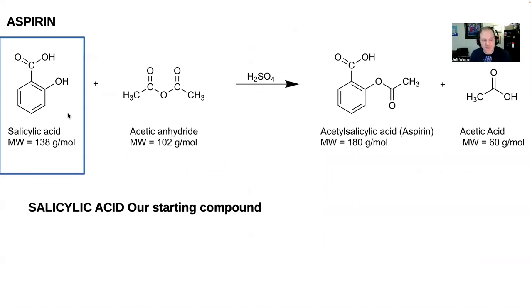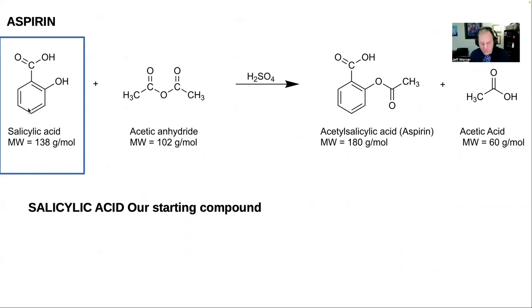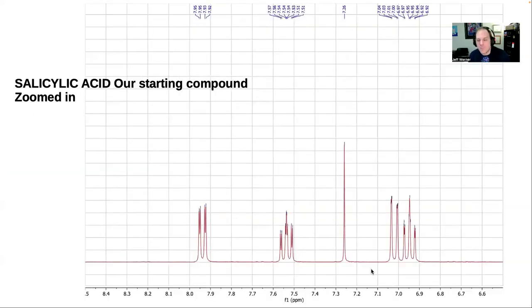So what does salicylic acid look like? If I take some salicylic acid straight out of the bottle, it looks like this. It looks different, right? There's something different going on here. Specifically, let's look at this pattern here. This is the downfield area associated with this aromatic ring, which is what's going to give us the most information to tell these apart. You can see that this pattern is different. This peak here is actually the same. Look at that, 7.26. It's in exactly the same spot, and it's a singlet, meaning it's a single peak. Then we've got these other little clusters of peaks here. We've got one between 7.5 and 7.6, and one between 7.9 and 8. And then we've got this other cluster here that looks totally different, between 6.9 and 7.05 or 7.15 or something.